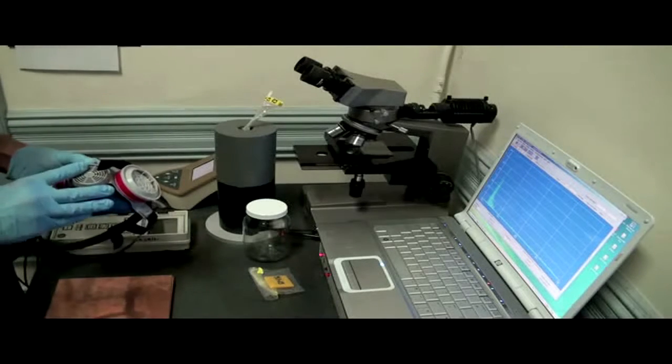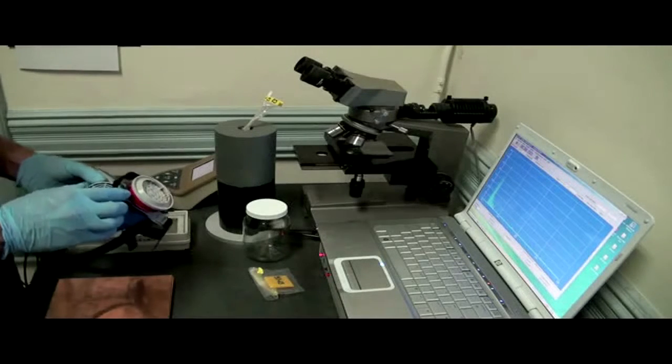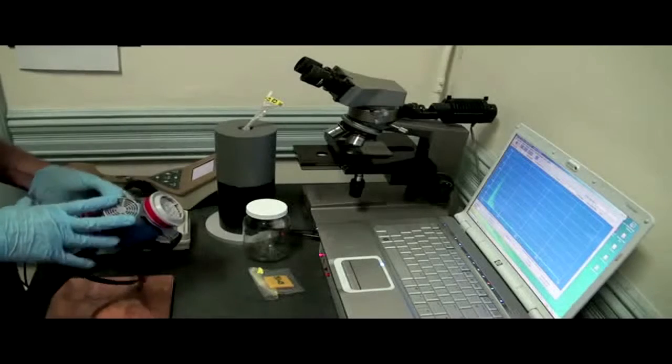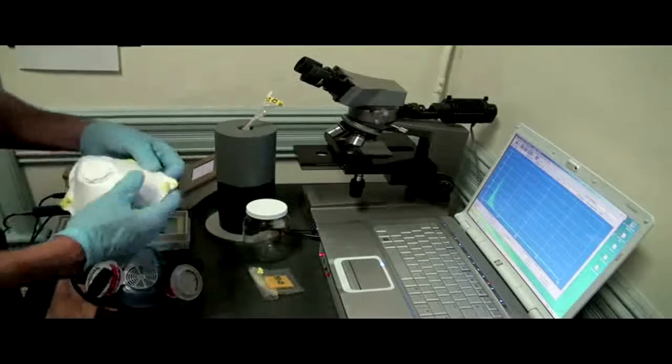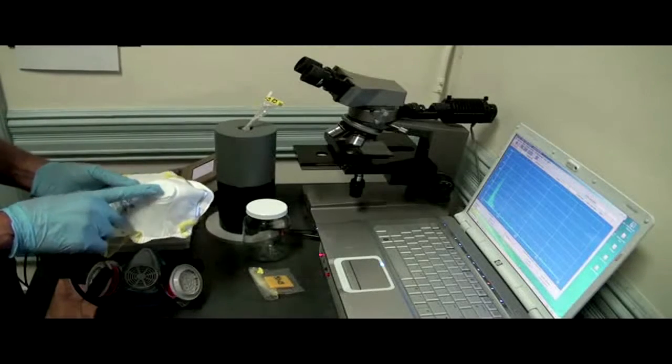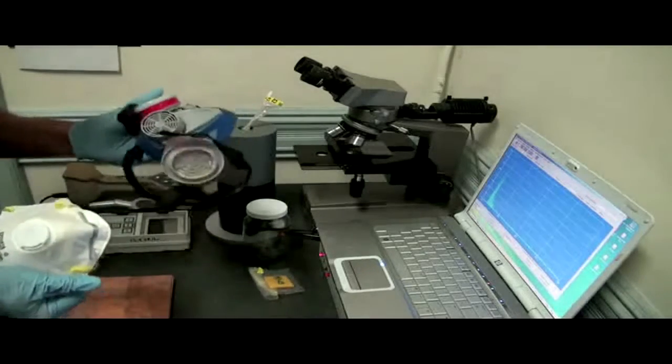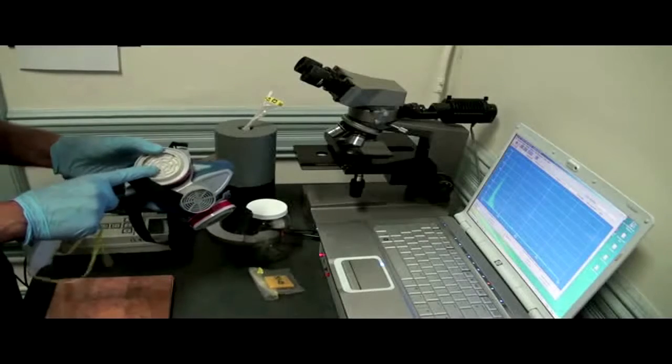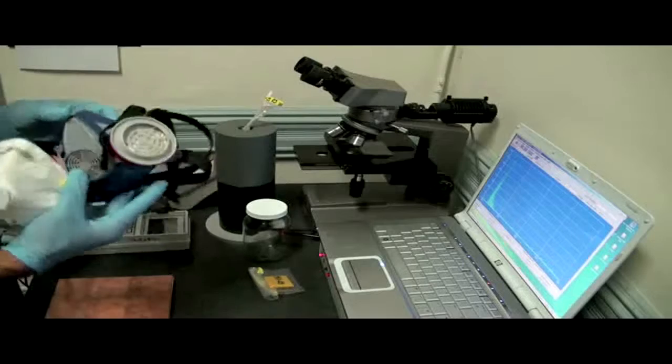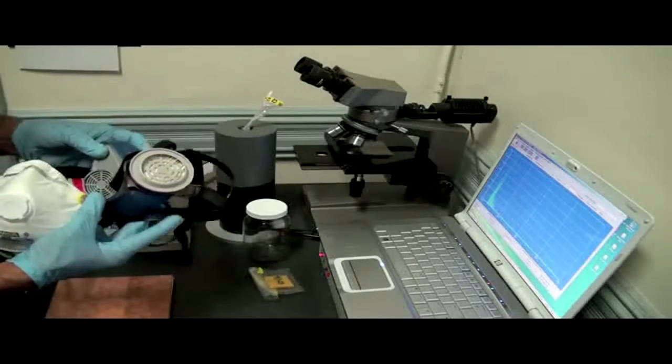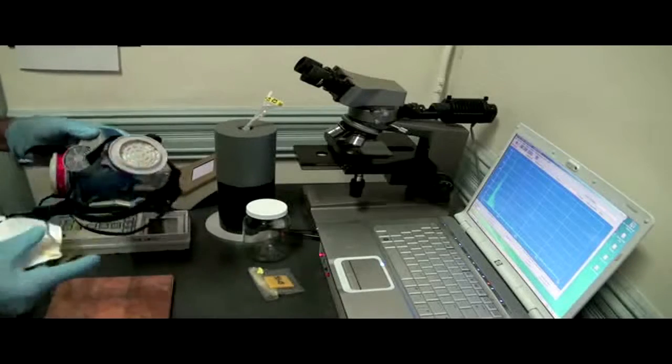So having a good dust mask is always a nice idea and something you need when you're doing your sampling. Remember that if you're going to open up a vacuum cleaner bag to take a sample, potentially a lot of that dust is going to be flying everywhere. I like to do that outside and not cause any further contamination in the home being sampled. You might have some of these. Paper dust mask. This one has a little valve in the front to make it easier to use. They're better than nothing. But really, it's worth investing the $30 in getting one of these, getting a good dust cartridge to go with it. It doesn't take out toxic gases. If someone to expose you to something like ammonia or some other fume, it doesn't protect you, but it does keep out the dust. And that's very important.